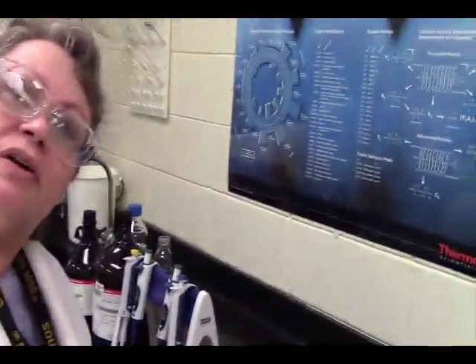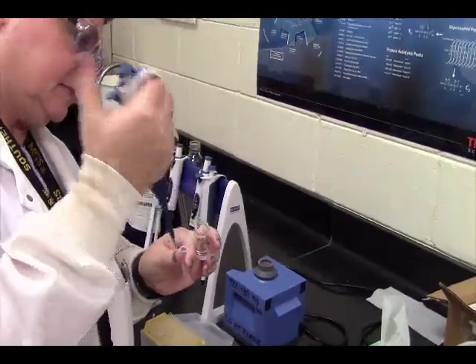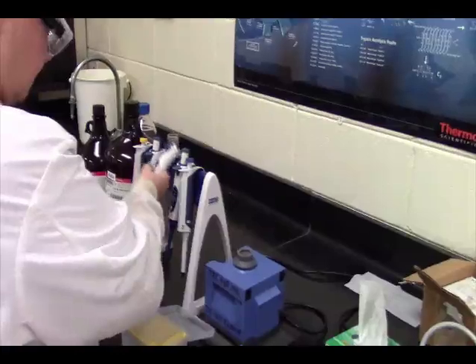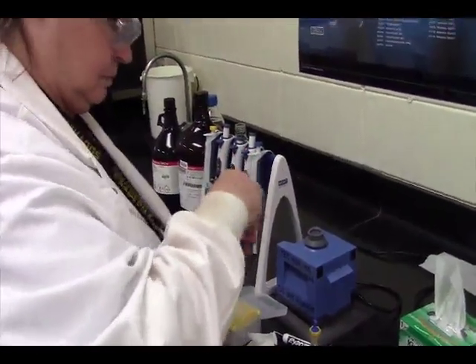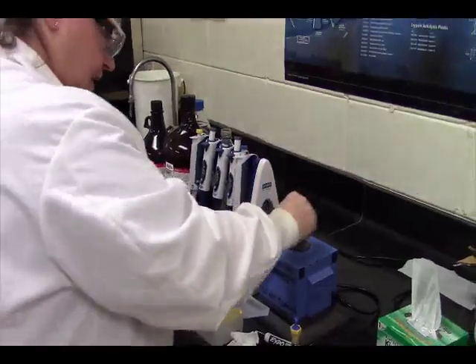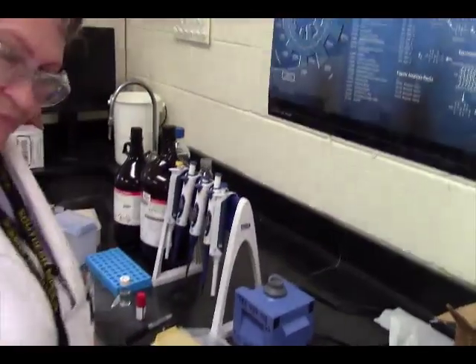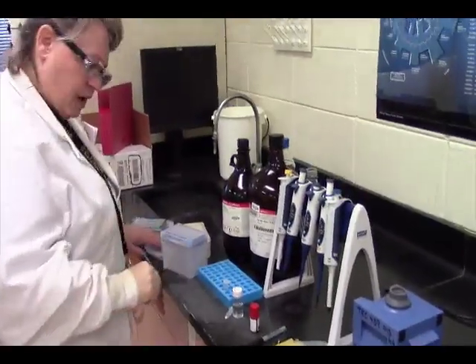That's what 1 microliter looks like. See that little bitty dot in the bottom? That's it. We're going to vortex that. Might have to shake that down to get our drop because we've only got a few drops in the bottom of that now. Alright, and that's what we're going to spot our plate with.